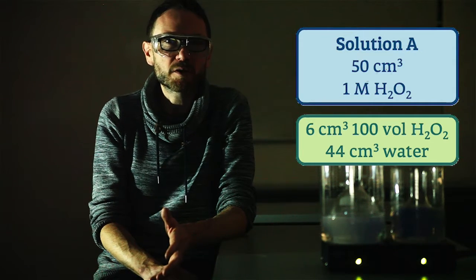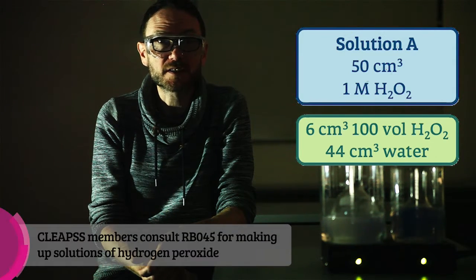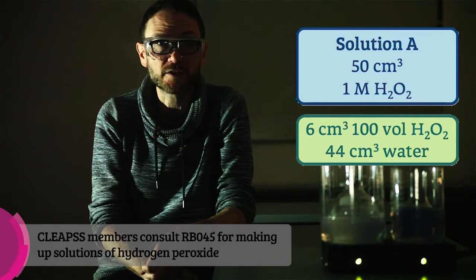Remember to always make up your peroxide fresh, and if you're a CLEAPSS member do check out RB045 before making up hydrogen peroxide solutions.